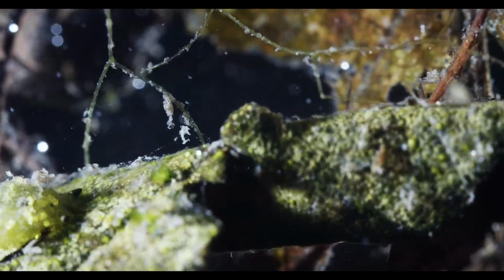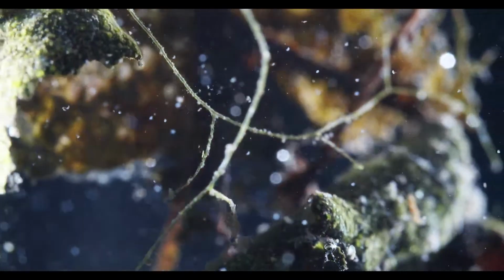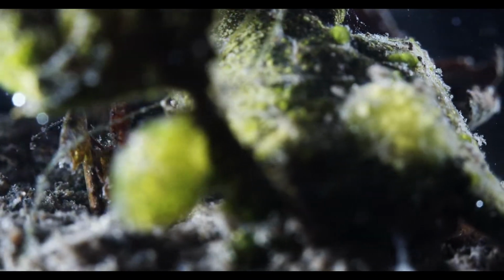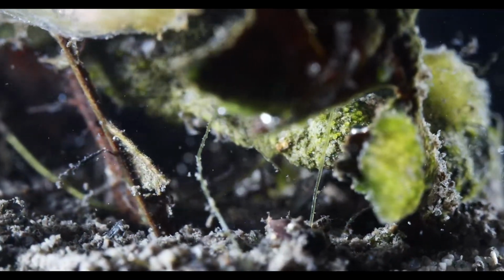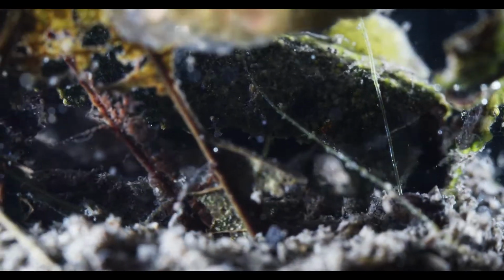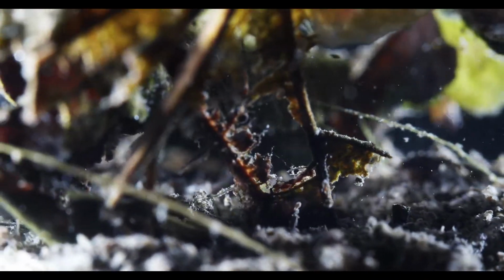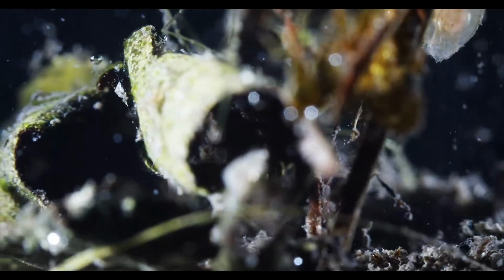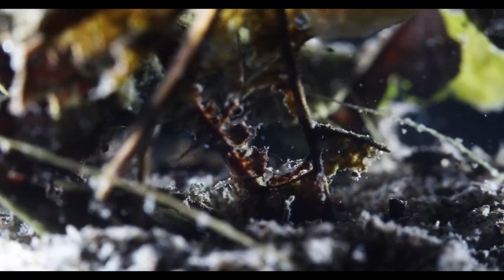Anyways, it's an aquatic beetle, and unfortunately info on some of these things is really hard to get. I know it's a Haliplus genus. There is a Wikipedia article on that, and it's in my book, but it's only a description of appearance and the range where they can be found. Habitat maybe, but I didn't find any info on the diet, what these guys live on, if they are predatory or if they're algae feeders or whatever.